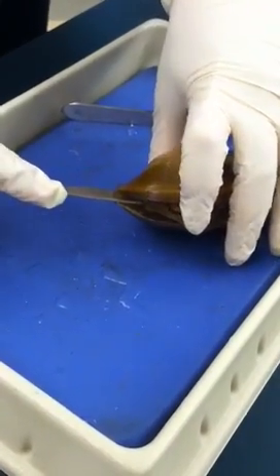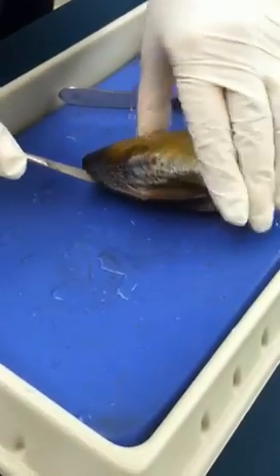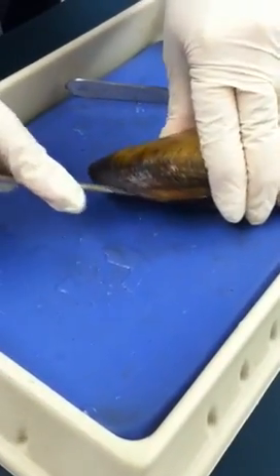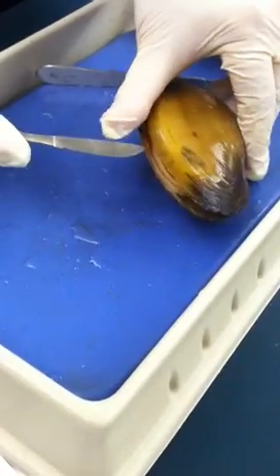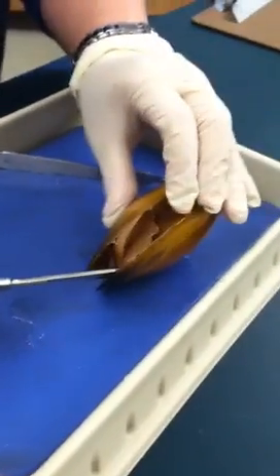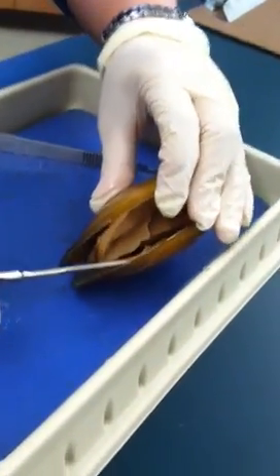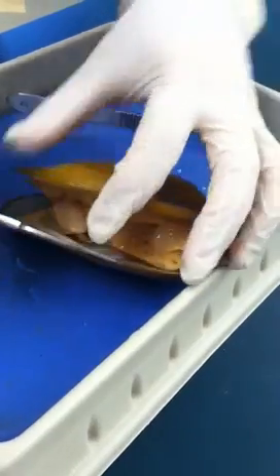When it opens up, that means you're doing it right. Then do the same thing on the other side — cut along the edge, and it will open up. When you go into it, you have to scratch the internal structure gently so you wouldn't break everything.